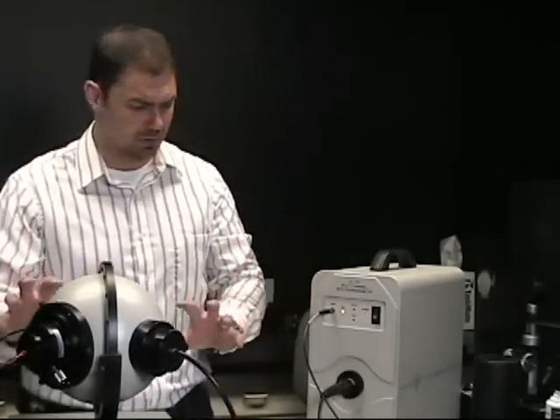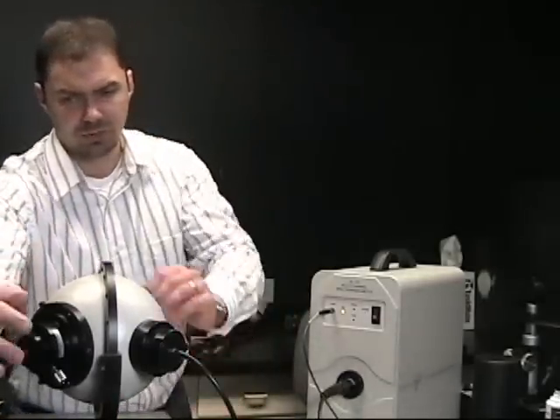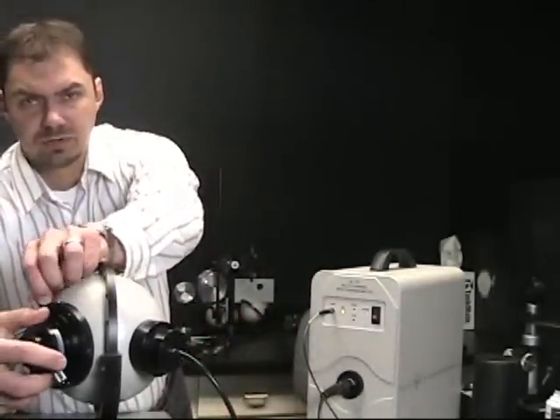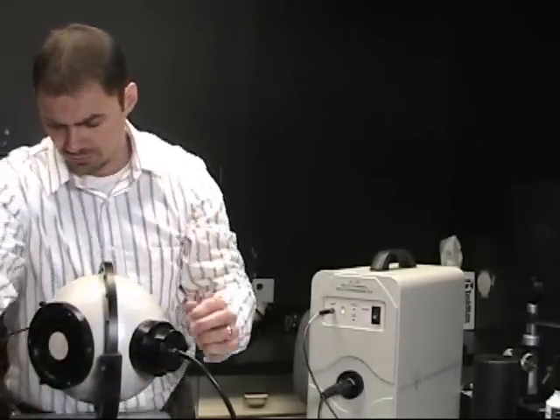Now that we went through the total luminous flux portion, I'm going to move on to the radiant intensity portion of the demo. We're going to use the exact same setup we did for total luminous flux, except what we're going to do is I'm going to remove the LED holder and adapter from the sphere.